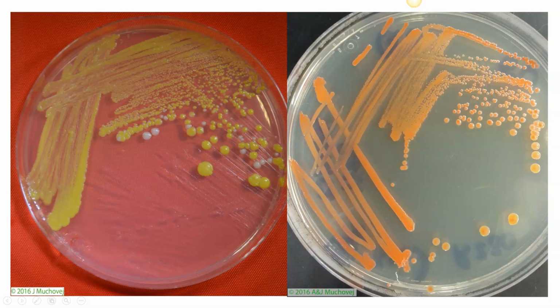Let's look at bacteria and what we can deal with as far as bacteria goes and what we can understand from them. These are two plates of material that have bacteria in them. You can see that there are different colors associated with it. You can see that there are different sizes and formats of the colonies associated with it. One of the things you see is that they are basically a mucoid or slimy type aspect to them.